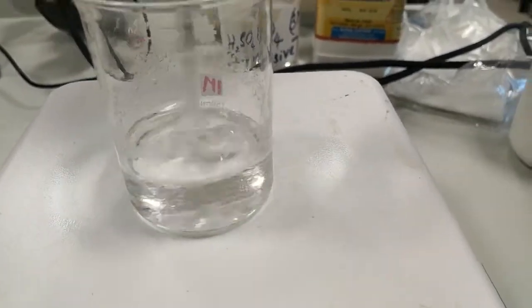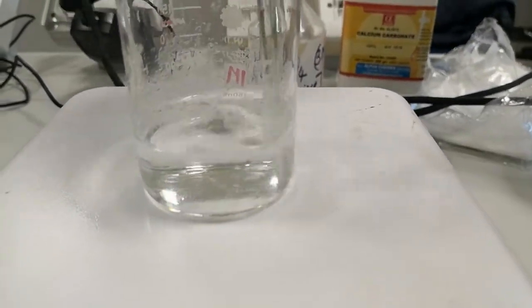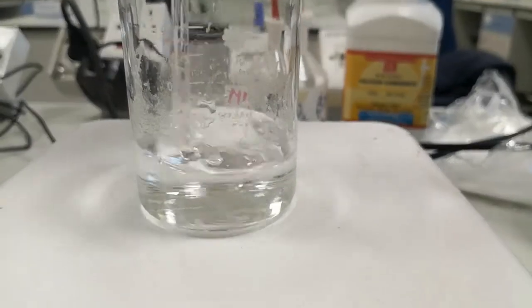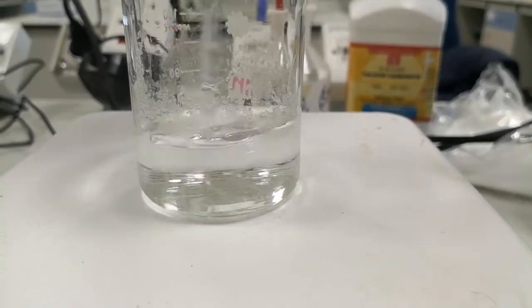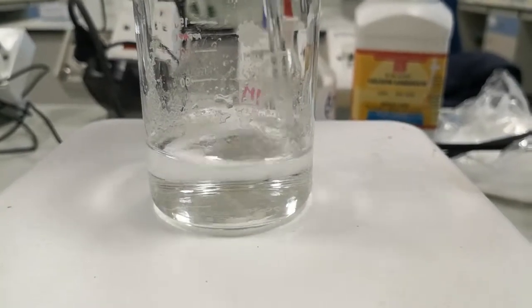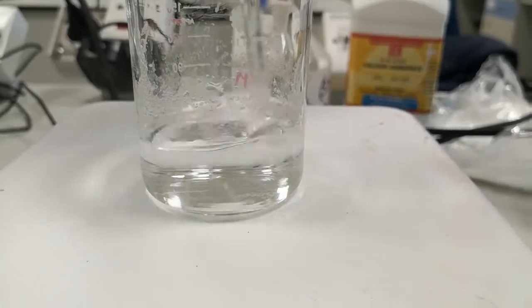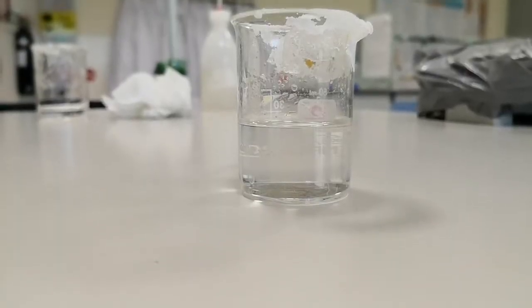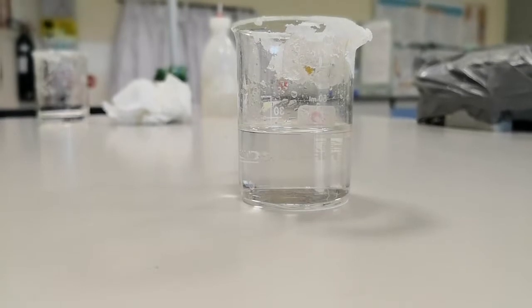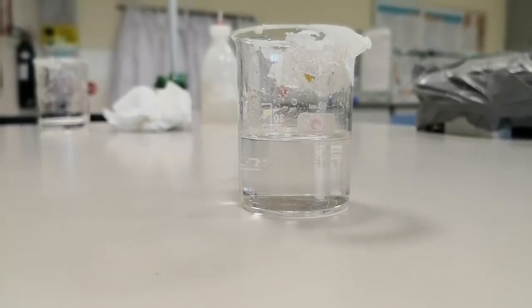After around three minutes of heating, approximately all the sodium acetate dissolved at higher temperature. This is the way how we prepare a supersaturated solution. Now this is the sodium acetate supersaturated solution that we prepared.